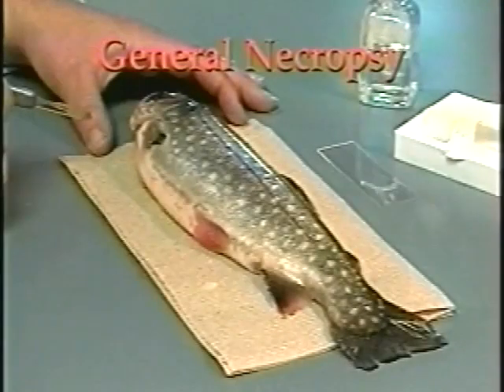A parasitological examination can be done using the general necropsy techniques demonstrated in the first chapter. Remember, if examination is concurrent with collection of samples for bacteriology and virology, samples for bacterial isolation are taken prior to examining for internal parasites.